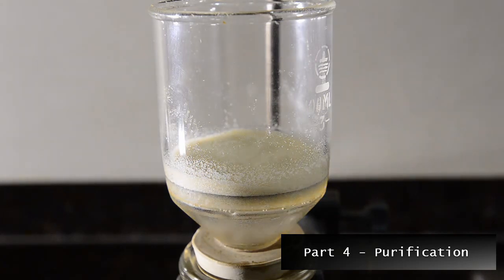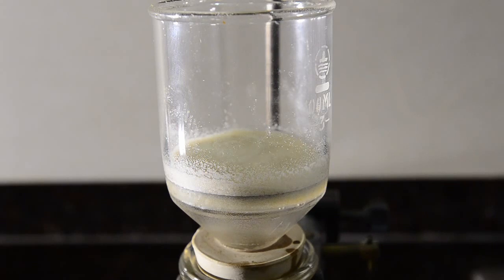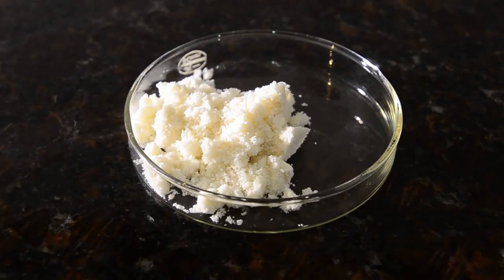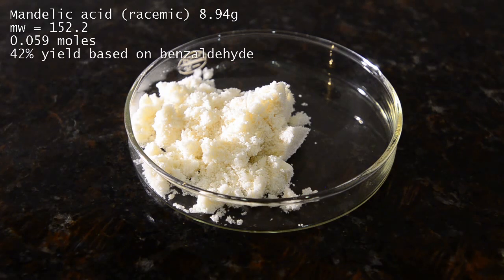If you have no chloroform, then dichloromethane will also work, but you will encounter greater losses of product. Here's our final dried product: off white and odorless crystals of mandelic acid.